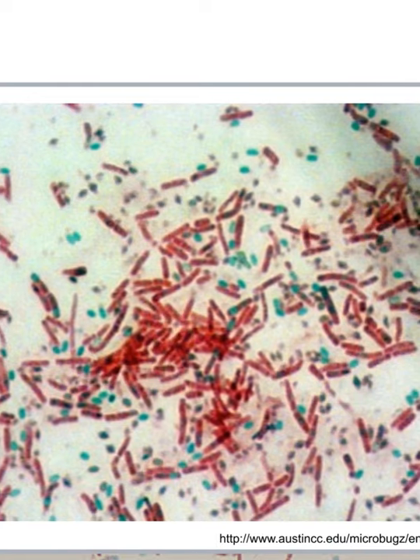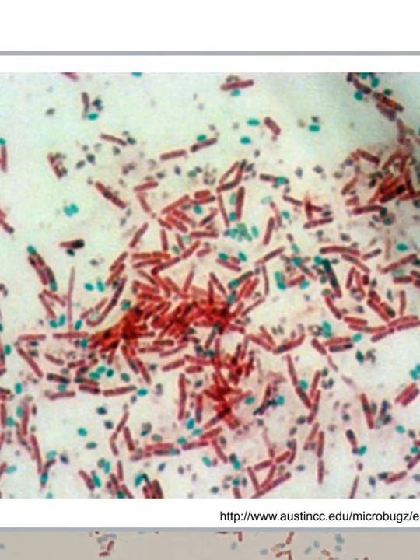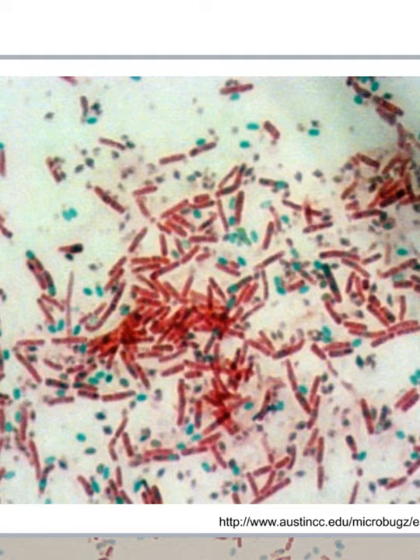Okay, so let me show you some examples of what we hope to see. This first picture, I just got this off the internet. I'm not even sure whether it's a Bacillus or a Clostridia or whatever, but I liked it because the colors are so distinct here. So here's a couple of free spores here. Definitely, I would call that green. Sometimes students say, oh, the spores are blue. No, I would say these are green. They should be green.